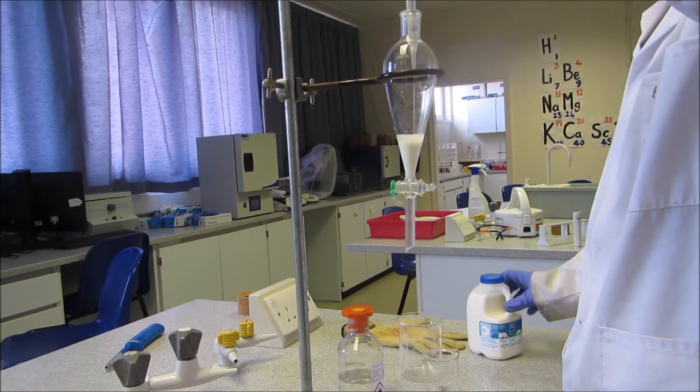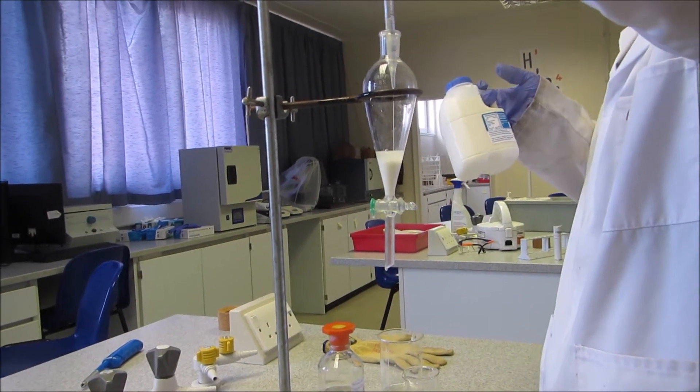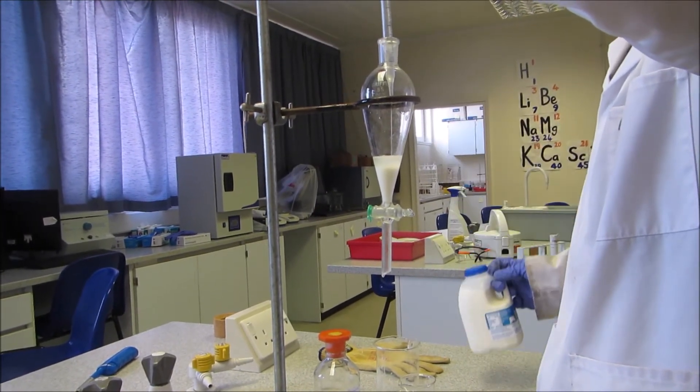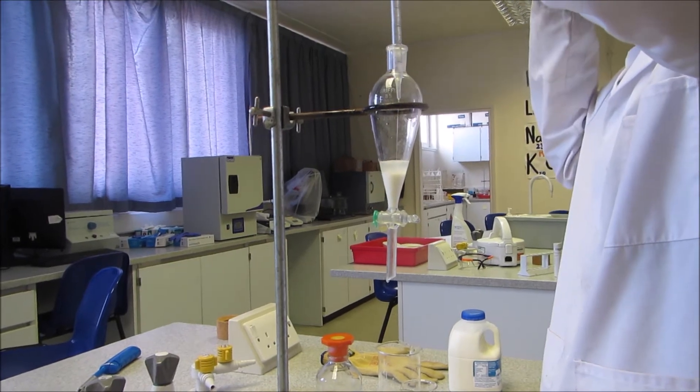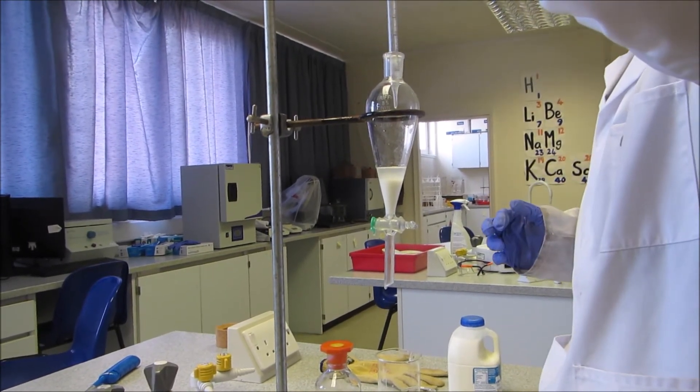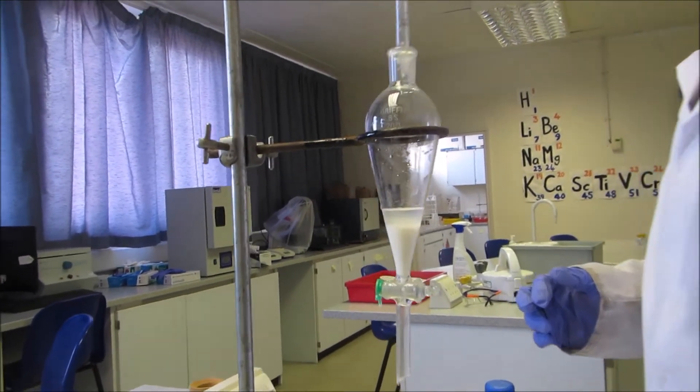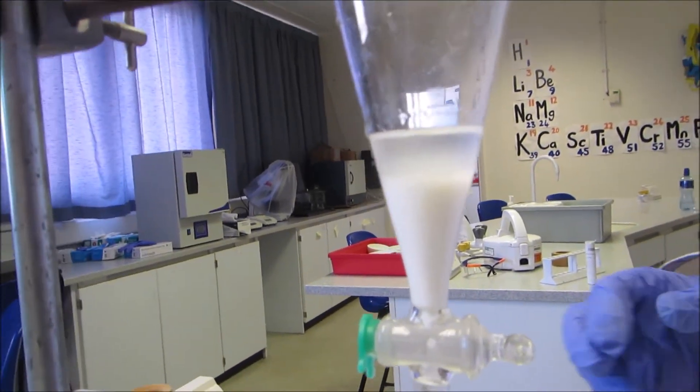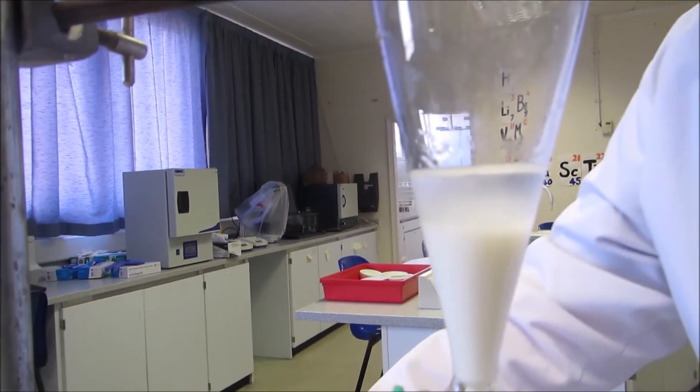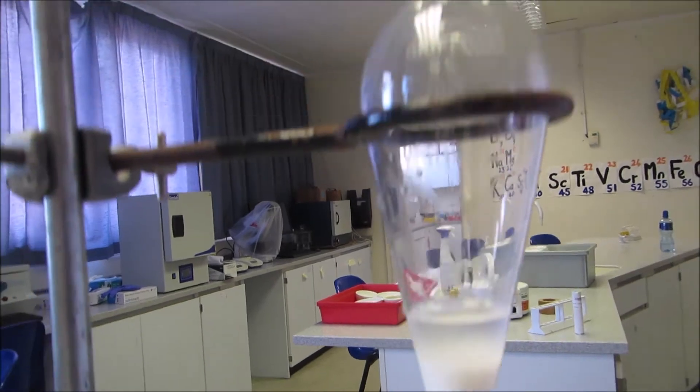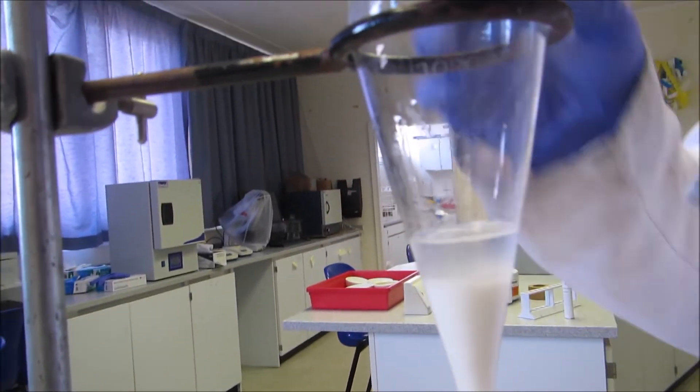So at the moment, all the fat is dissolved in the milk, but we want to work out how much fat there is. The fat is actually more soluble in our isopropanol and hexane. So once I come to mix it, the fat will move into this layer.